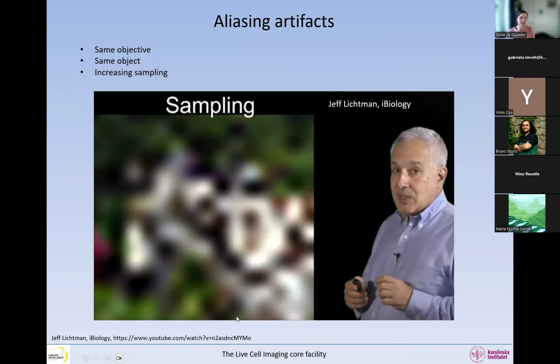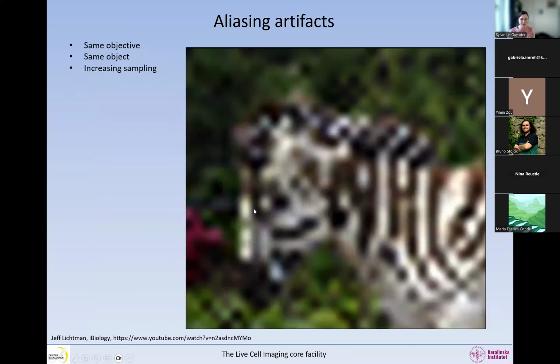I took these screenshots of a very nice video. I spoke about this before, the iBiology microscopy course, and Jeff Lichtman is one of the teachers. It just happened that I took videos of his two lectures. This is one of his lectures where he talks about sampling. In all the images that you're going to see, we are using the same objective, the same object, and we are increasing the sampling. Now we are really heavily undersampling the image, and that's what we see. It's a little bit difficult to guess what it is, but maybe you can guess. It's a zebra. So we have the same objective, the same object, but we're increasing the sampling.